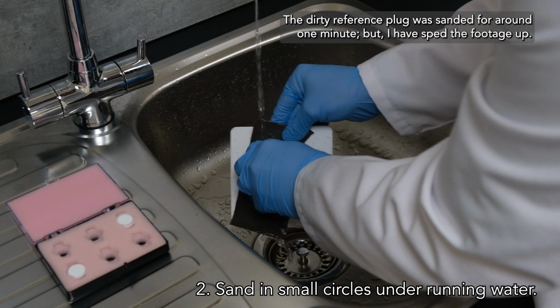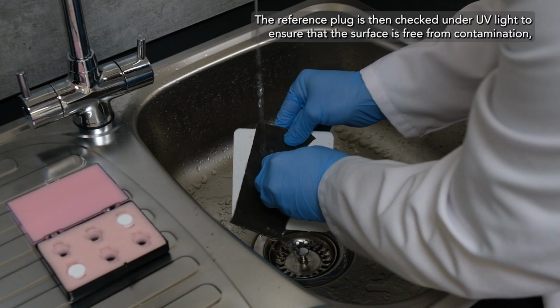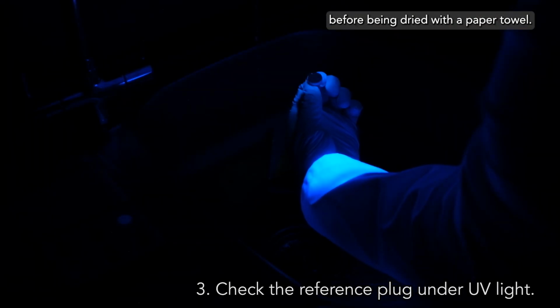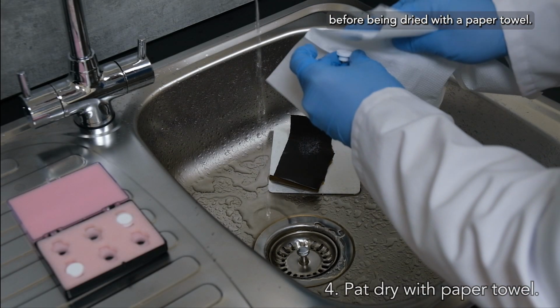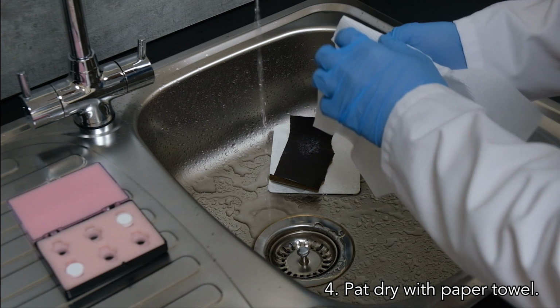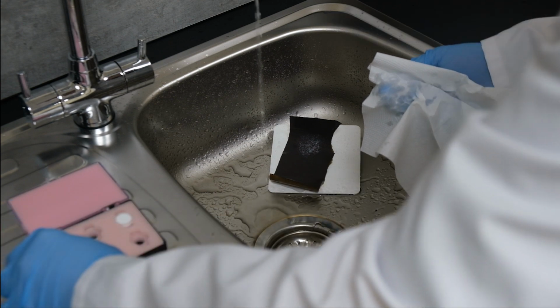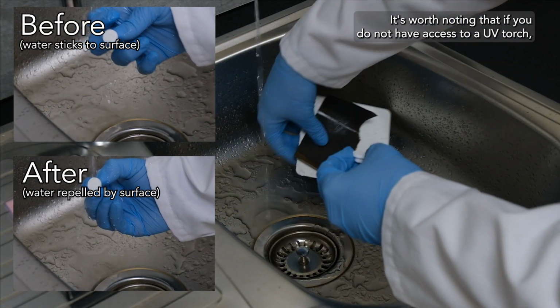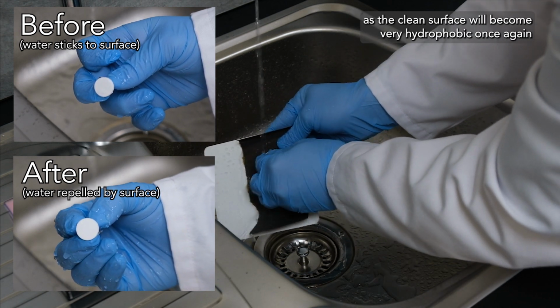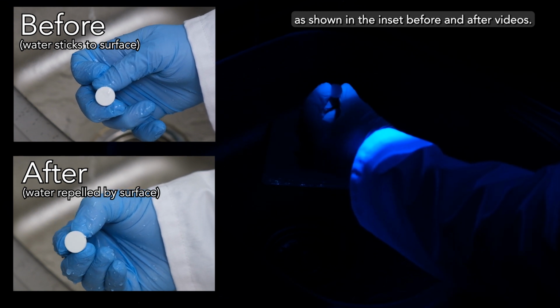The dirty reference plug was sanded for around 1 minute, but I have sped the footage up. The reference plug is then checked under a UV light to ensure that the surface is free from contamination before being dried with a paper towel. While I'm here, I will refresh the surface of the clean reference plug also. It's worth noting that if you do not have access to a UV torch, you can estimate when the surface is clean, as the clean surface will become very hydrophobic once again, as shown in the inset before and after videos.